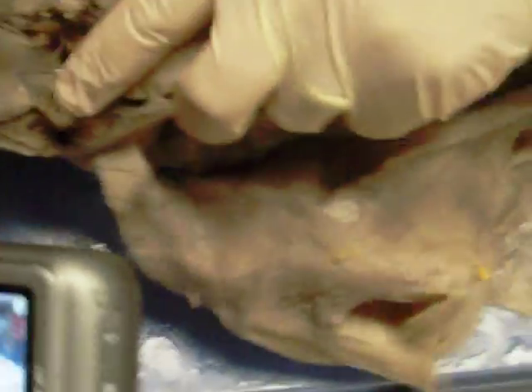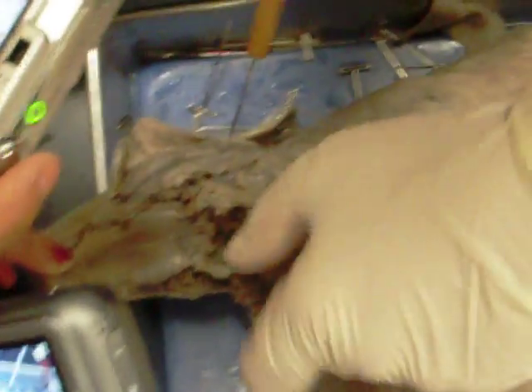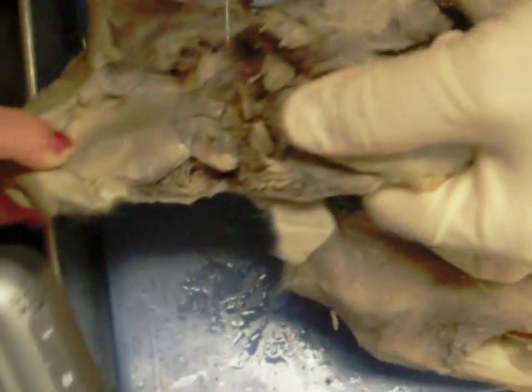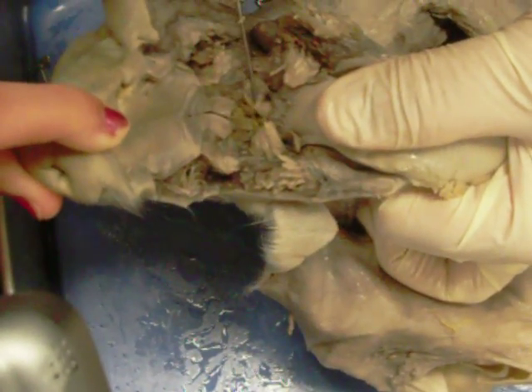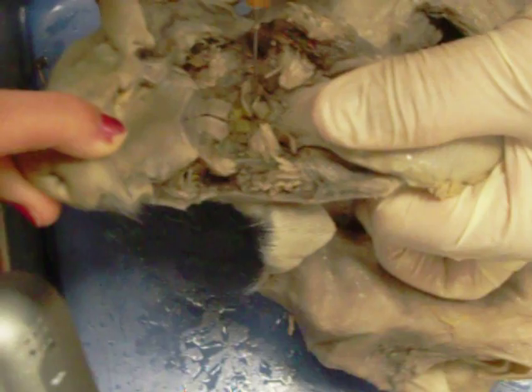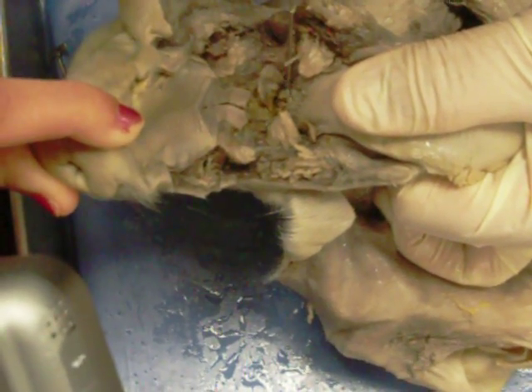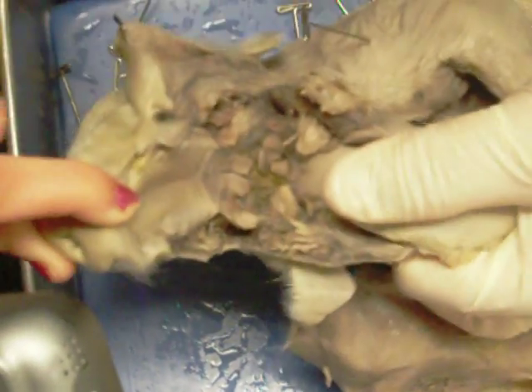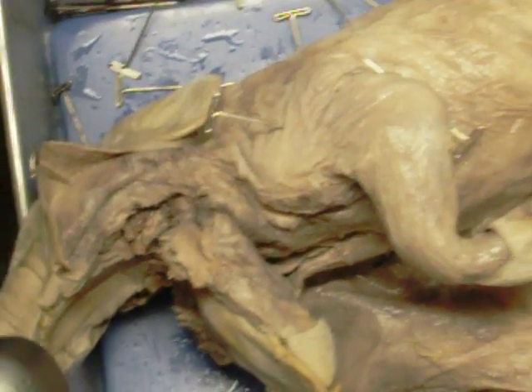We can go look at the other pig. If we move that down — that's the glottis, the opening to the trachea. And the covering is the epiglottis — the little flap is the epiglottis.